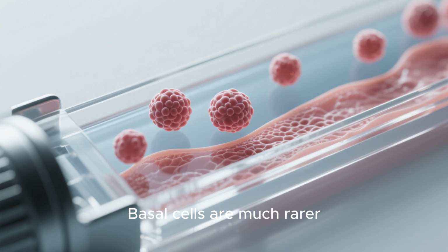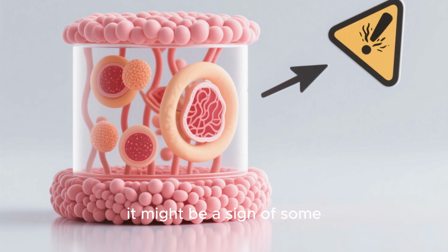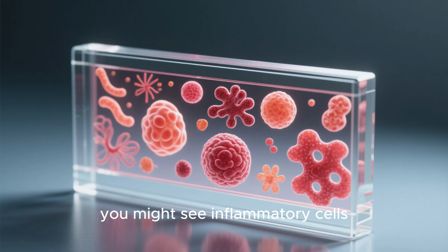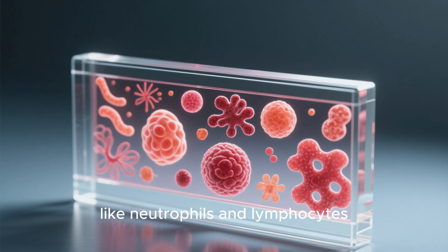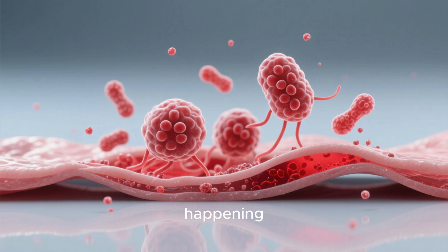Basal cells are much rarer to find in a simple swab. If you see them, it might be a sign of some kind of tissue damage or disease. Finally, you might see inflammatory cells, like neutrophils and lymphocytes. Their presence usually tells you there's an infection or inflammation happening.